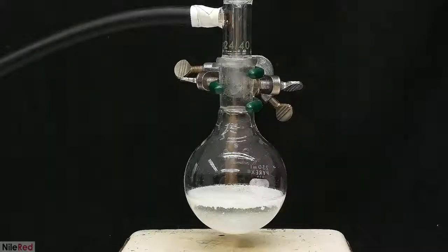To the vacuum adapter, I attached some tubing which leads outside. This reaction produces a lot of hydrochloric acid gas as well as carbon monoxide, so this definitely cannot be done in a closed space. My workspace is extremely well ventilated, and I just added this tubing as an extra precaution.